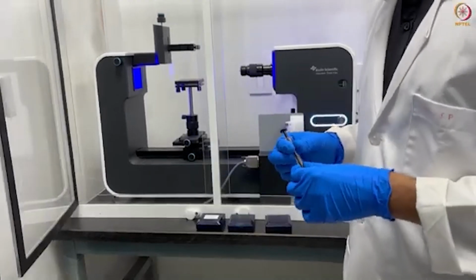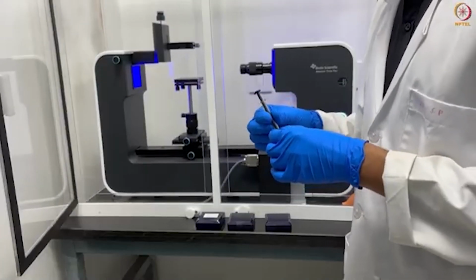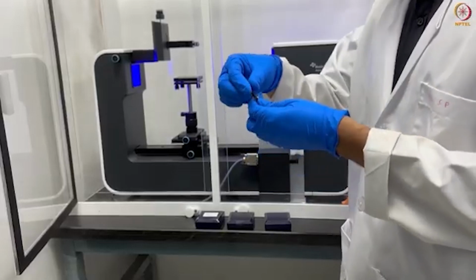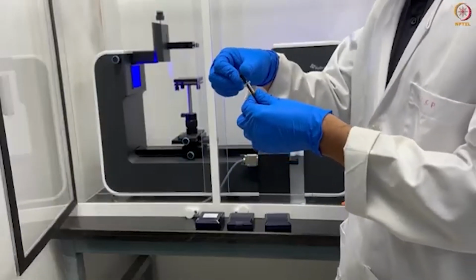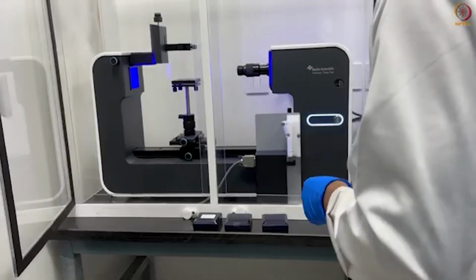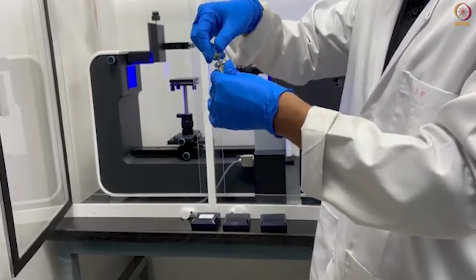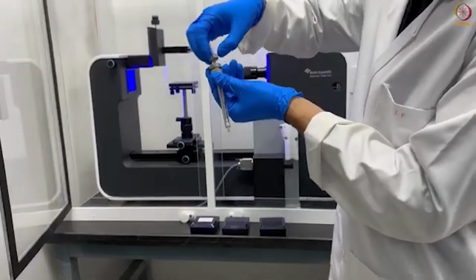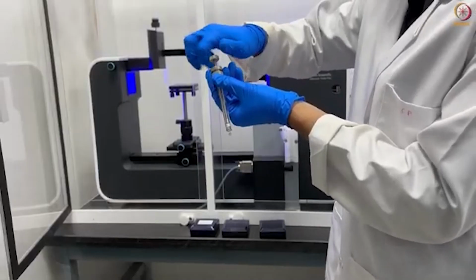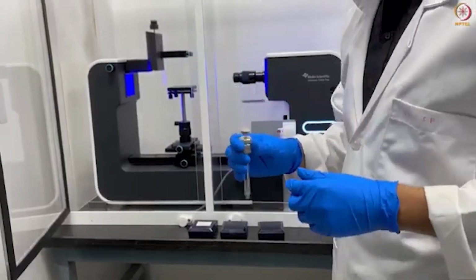Here I am showing you the manual operating syringe. This is made by Hamilton. This also can be used with the help of a syringe pump. To use this syringe, just rotate it manually. By rotating, you can open and close it. Or we have one more syringe needle. You can see here, this moves by rotating it anti-clockwise or clockwise. This will drop liquid.